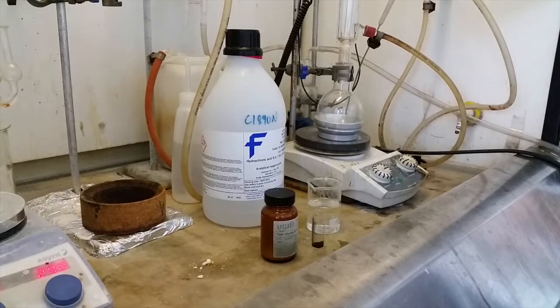Hello and welcome back to Porphyrin Bootcamp. Today we'll be showing you how to reduce the nitrated porphyrin you made last week to form TPP-NH2, an amine porphyrin.